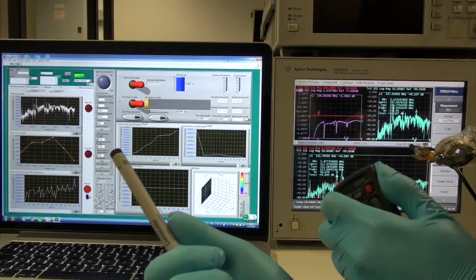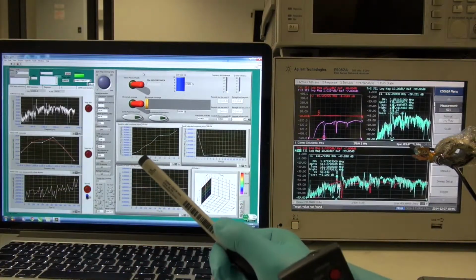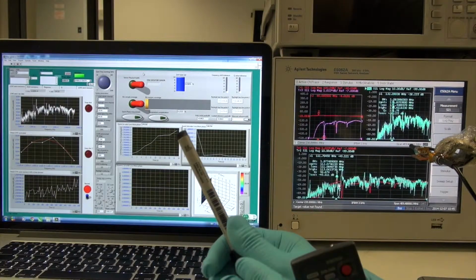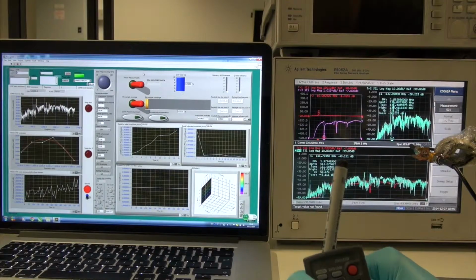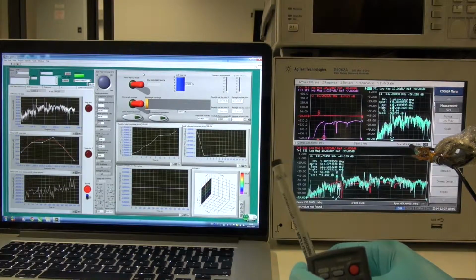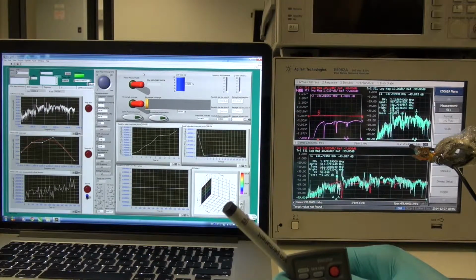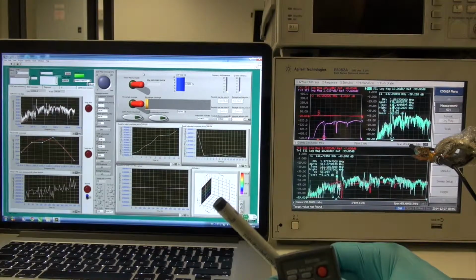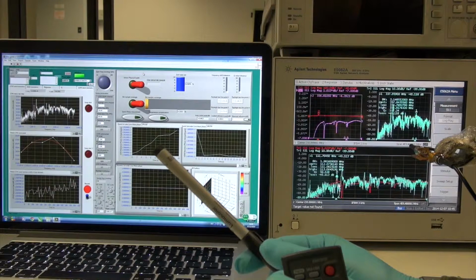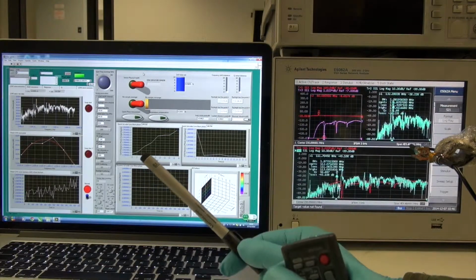Okay. In the device diagnosis panel, the first function is the device health diagnosis function. This function is based on measuring the zinc oxide layer condition. Because the zinc oxide layer is vital in our device, when the microfluidic chamber is engaged, the solvent and the DI water inside of the chamber can dissolve or etch the zinc oxide layer, making it porous. So if the zinc oxide layer has been damaged, we can measure the extent of the damage by measuring the first order Love wave resonance peak without any liquid contact.